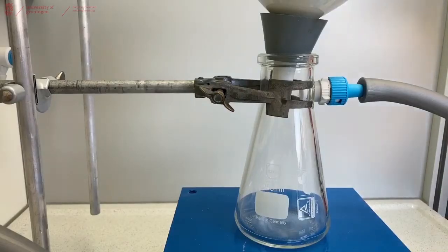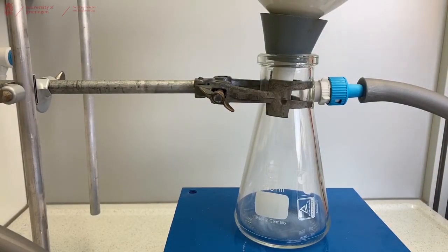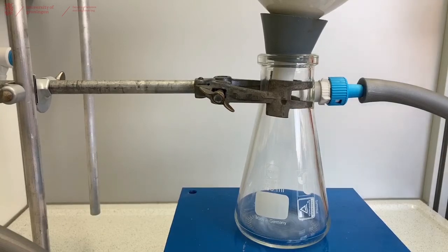Now that we built our setup, we can apply a light vacuum by either turning on your pump or turning on the inline vacuum system.